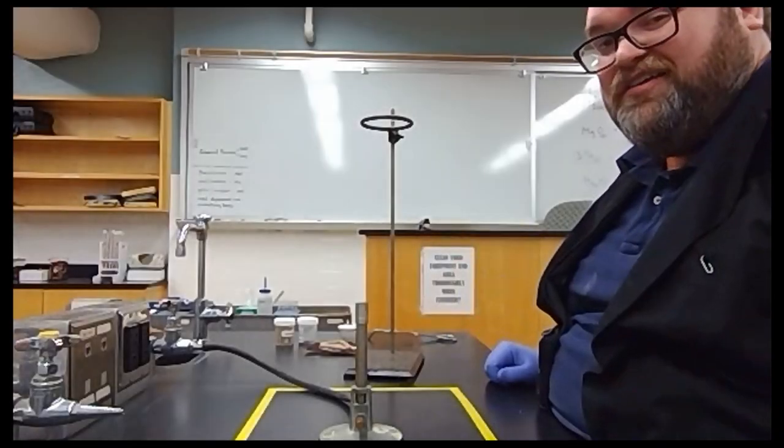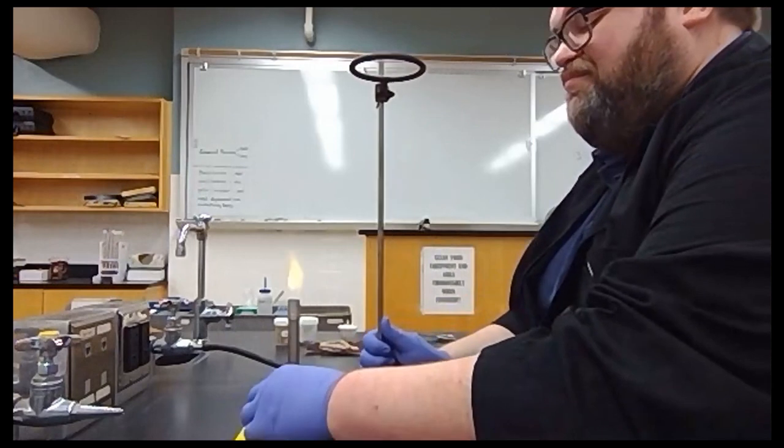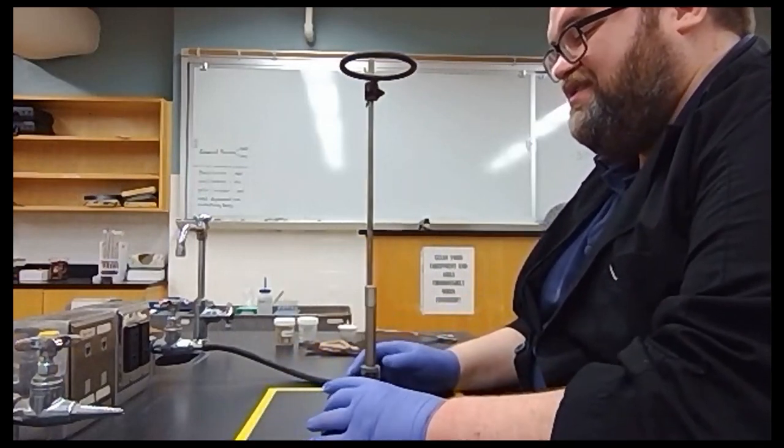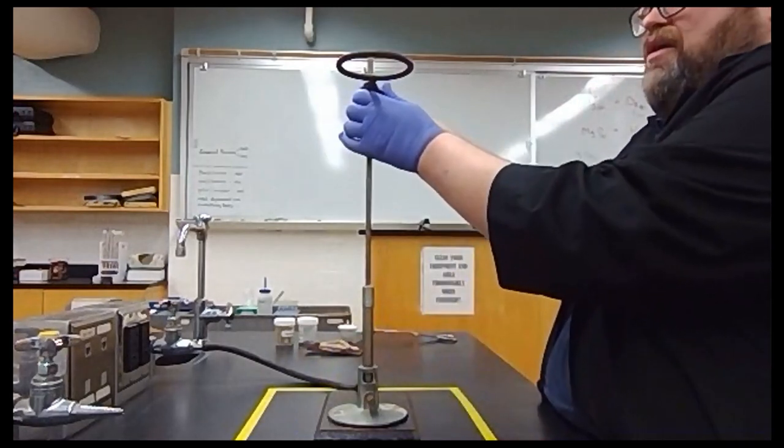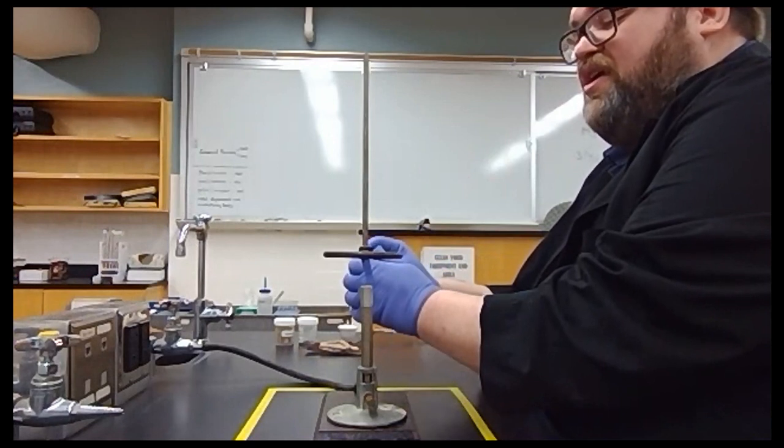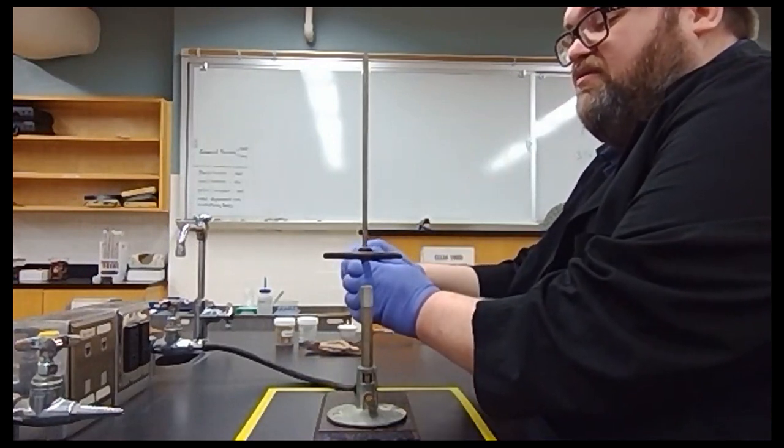Now that we've got our two stable blue cones, we're going to bring our iron ring stand back in, place our fire onto the iron ring stand, and we're going to lower the ring. We want to lower the ring such that the inner blue cone is just on the inside of the center of the iron ring.